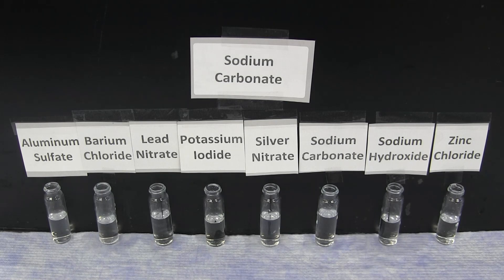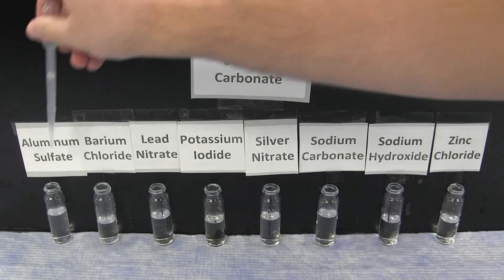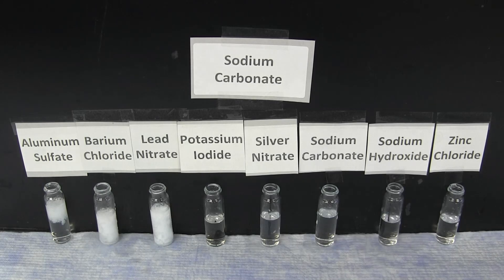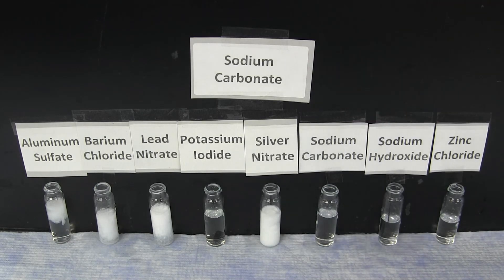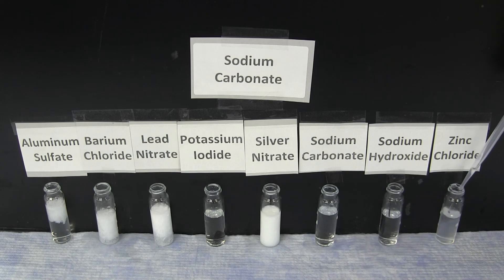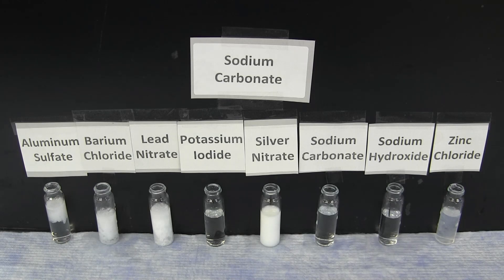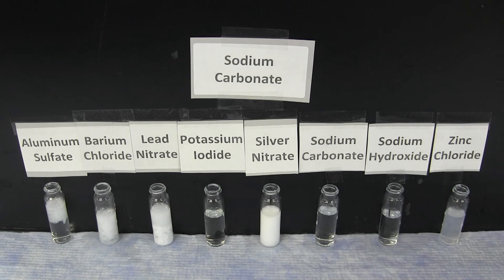The next reactions are those of the sodium carbonate. The sodium carbonate forms a bright white precipitate with aluminum sulfate, barium chloride, lead nitrate, and silver nitrate, as well as an opaque, almost gelatinous precipitate with zinc chloride.